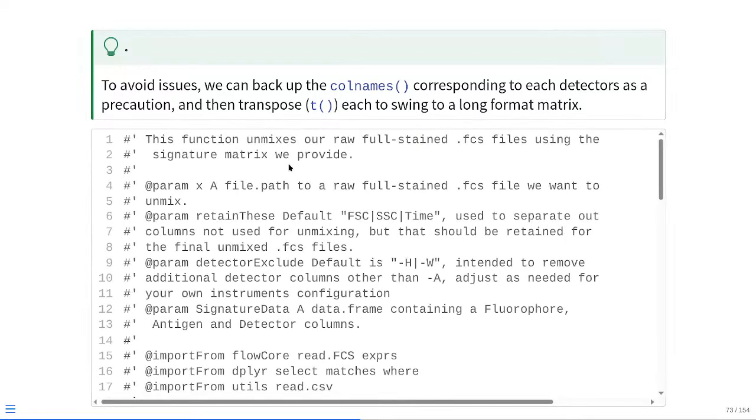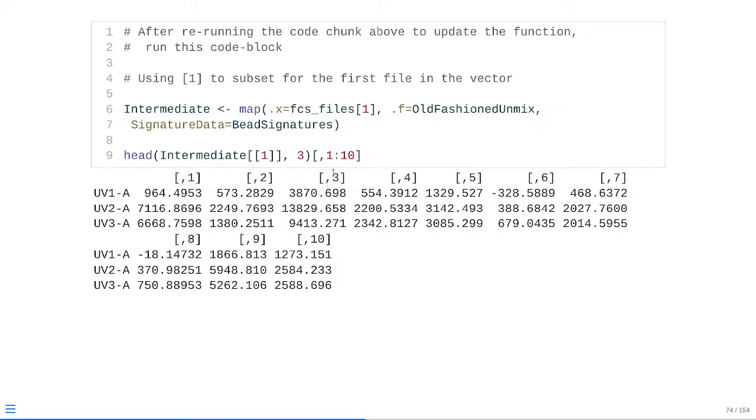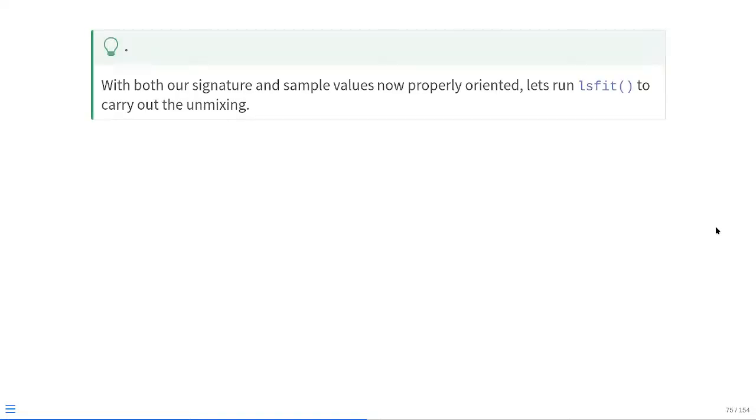the t() function. As we scroll down, we see a new section down here, and we're saving those column names just in case for later, and then transposing the numerics, transposing the working columns, saving them as their own objects so that we're able to work with them later. And at that point, we can internally check, and sure enough, instead of having our detectors on the columns, we now have our detectors showing up in the row names. We ended up having to select a little subset of the columns because we had 10,000 now. So this is why we have this little complicated visualization code line here just for the website's sake, so it's not 200 or so pages of output lines across the board. So with both our signature and sample values now properly oriented, we can run lsfit to carry out the unmixing process.